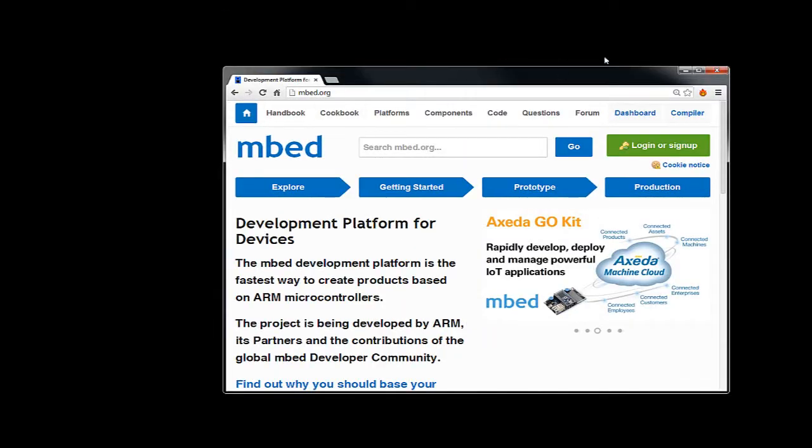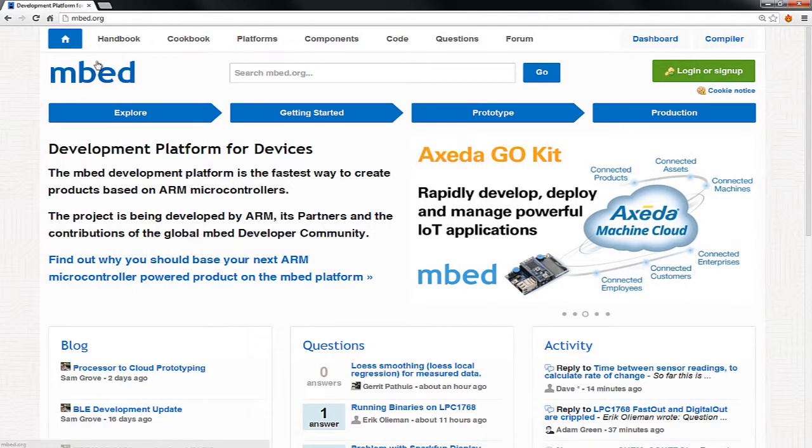All right, in this video, we're going to go through the software on the Chem control box, the reference software that you're given, how to use it, and how to program it to get you started. Before we begin, I'm going to bring up the website for Mbed.